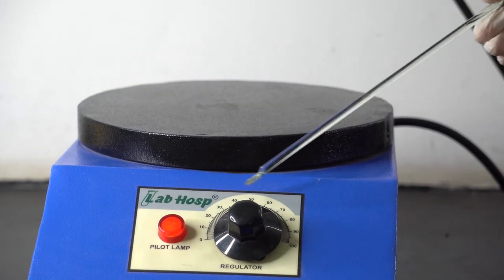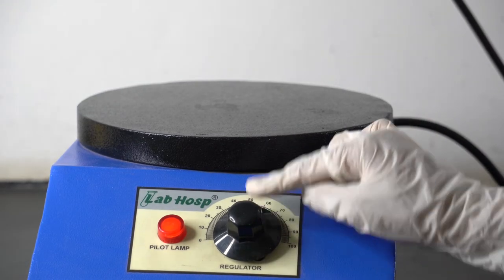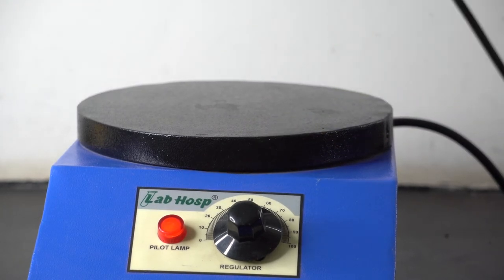A hot plate is a standalone appliance used in soil science and microbiology laboratories as a tabletop heating system for heating glassware and its components.